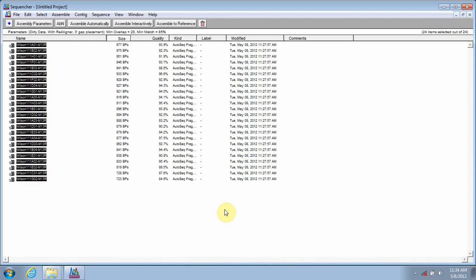So trimming of your raw sequence data is one of the most important quality control steps that you can take in the pre-processing of your sequencing data. With an average increase in quality scores of around 15 to 25%, taking this one step can greatly improve your chances at successful downstream analysis.